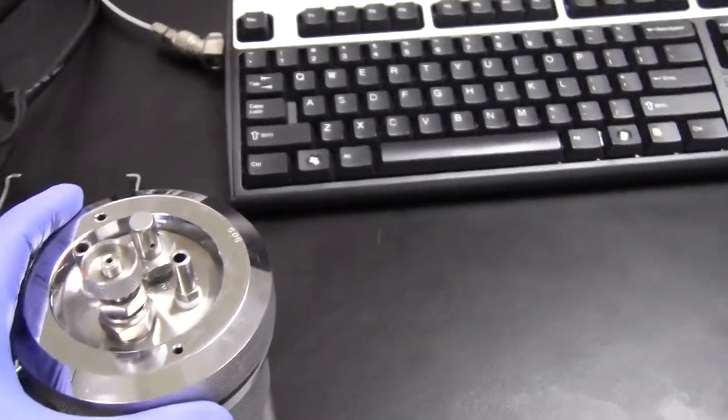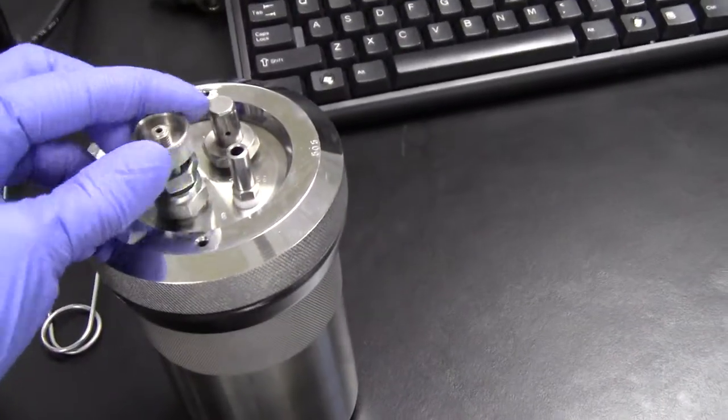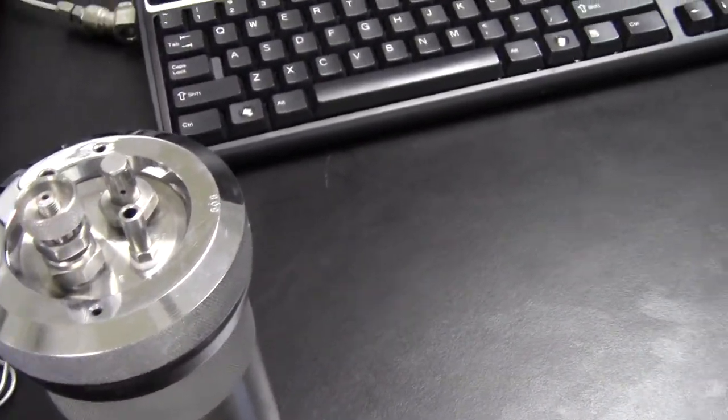So now our sample is inside the bomb and the bomb is sealed nice and tight. We also want to make sure that this pressure release valve is also closed.